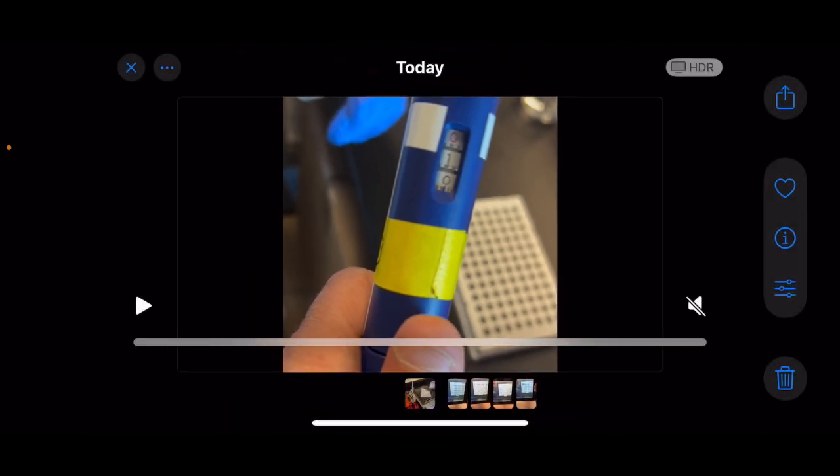So this step of the video was an error, because I just wanted to show what volume I pipetted, which was 9 microliters, but I said 1 microliter in the video because I forgot that I pipetted 9 microliters.